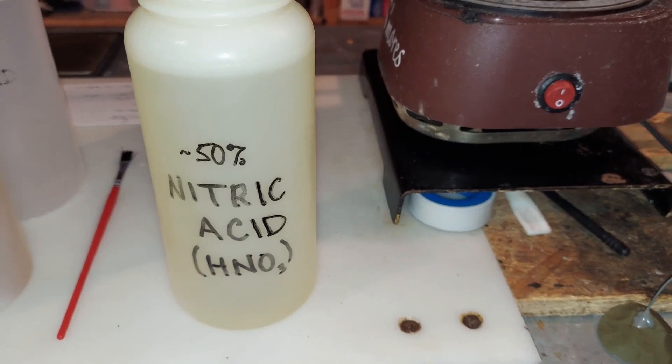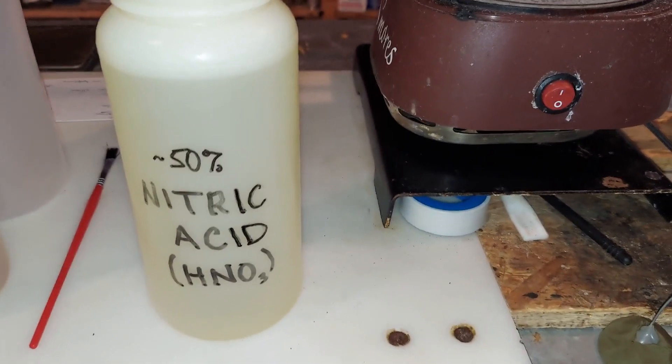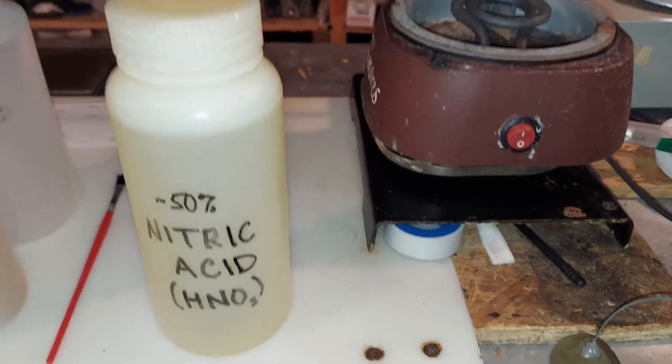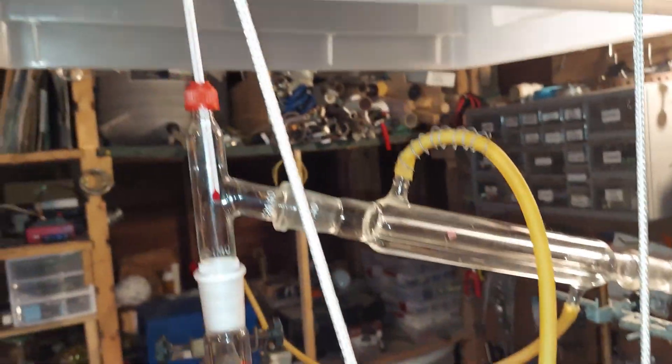This is something called fractional distillation. I've set up the glassware to do this. It's a distillation. You can see that right here.